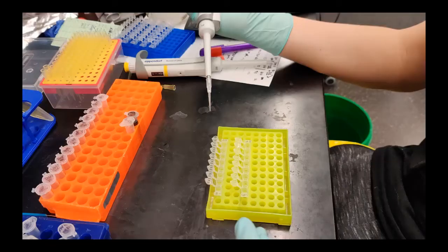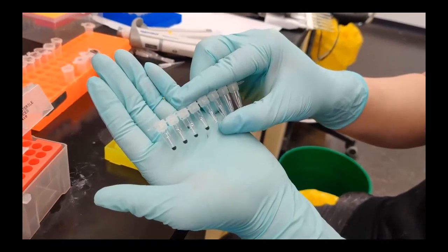So, to do PCR, we will take some of the DNA and mix it with primers. Can you see the mixture inside the tubes?